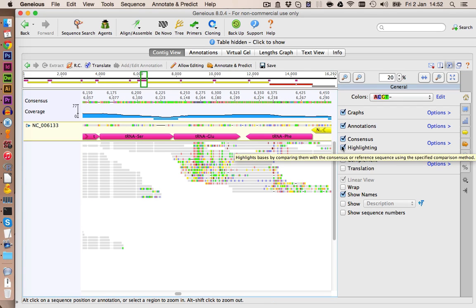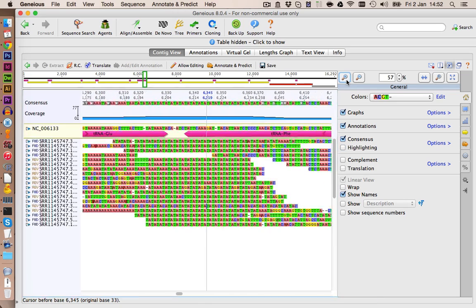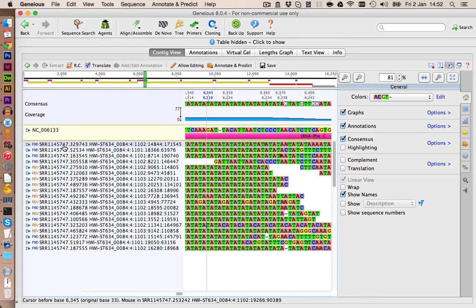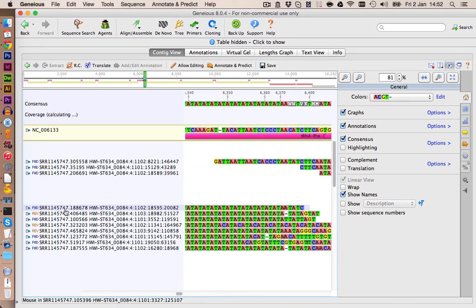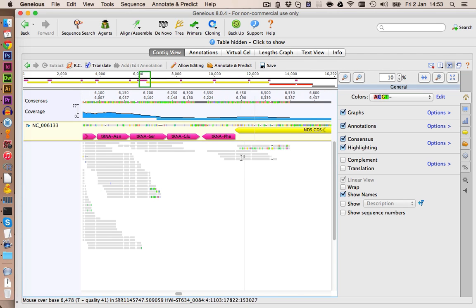This here also doesn't look correct. Looks like we have a microsatellite in here, and this is a hit which is quite common because the microsatellite, this repetitive pattern of TA, is quite common in the genome, so we should definitely get rid of all those sequences. Again, we're going to delete them. Let's turn highlighting on again. And the rest looks okay.